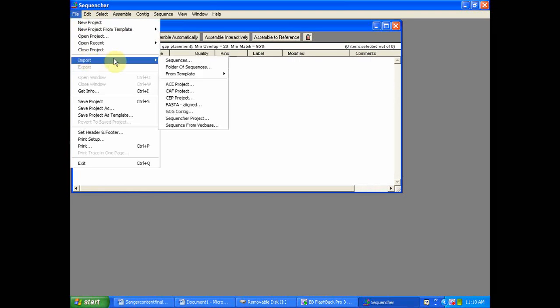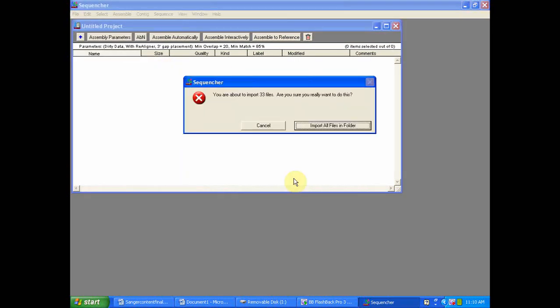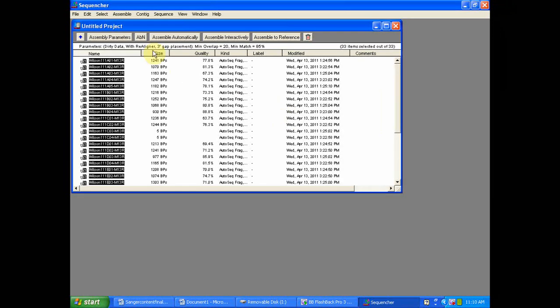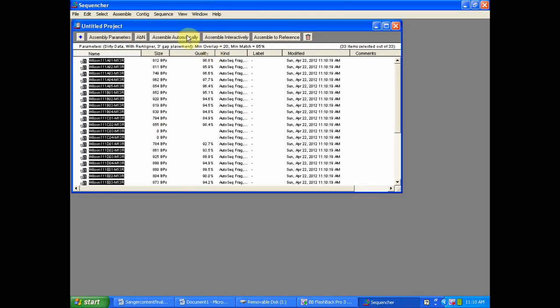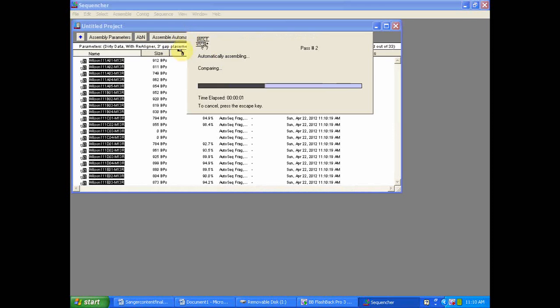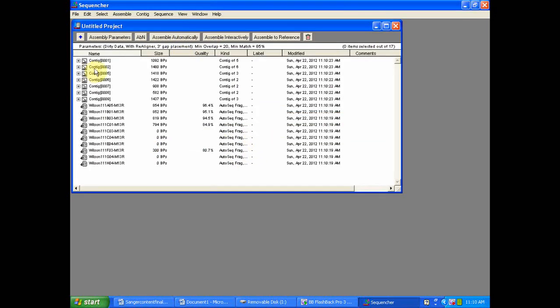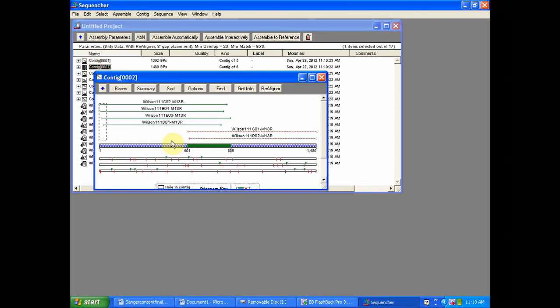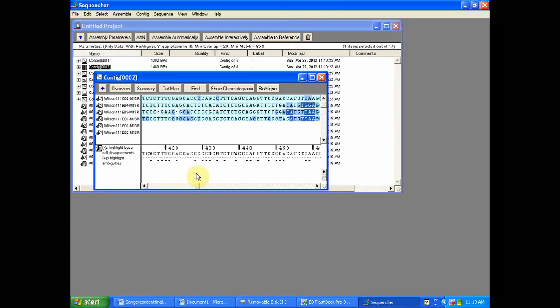Today I'll be showing you how to use Sequencher for initial quality analysis and control of your raw sequence data. These methods can be used to quickly and often dramatically increase the quality of your data and thus the results of any downstream analysis. Now it's important to remember as I move through the tutorials on sequence quality that the steps I'm showing you are not necessarily illustrative of the data assessment needed on a sequence-by-sequence or project-by-project basis.